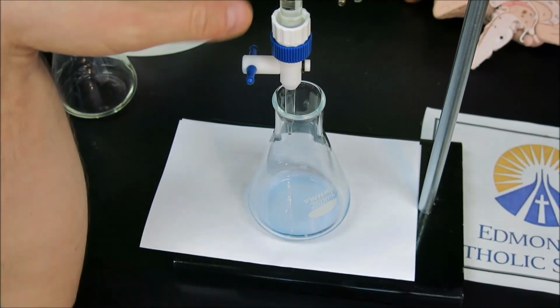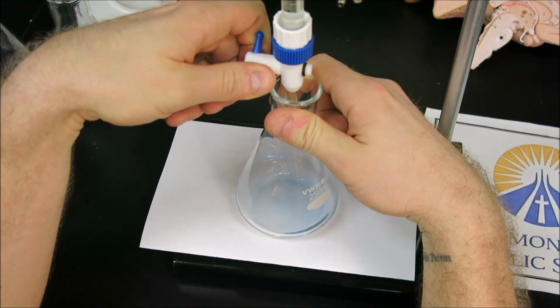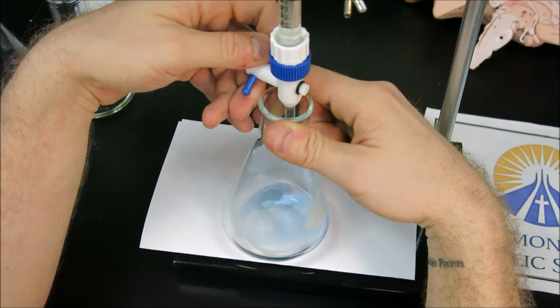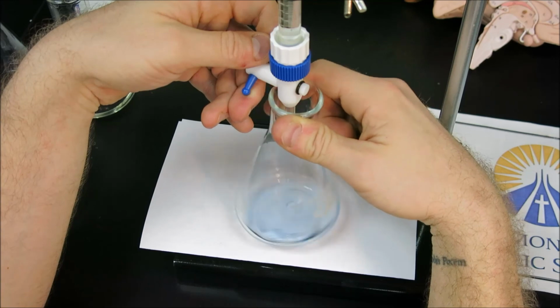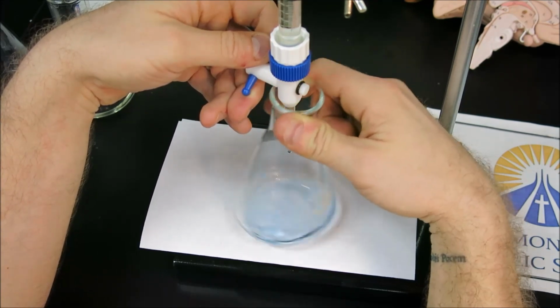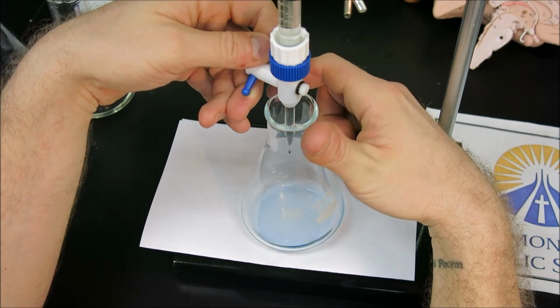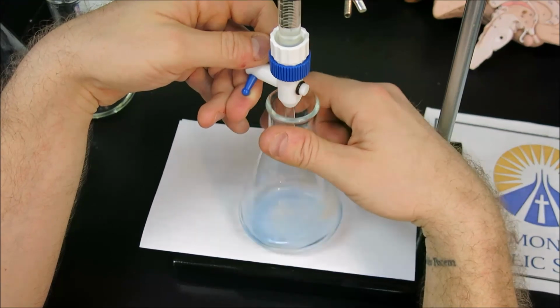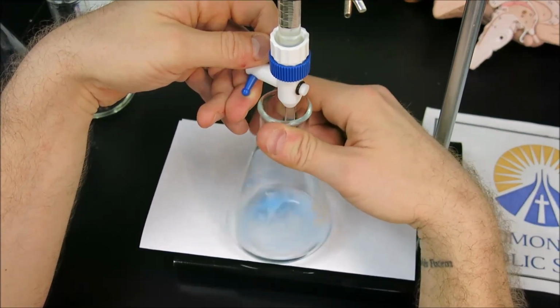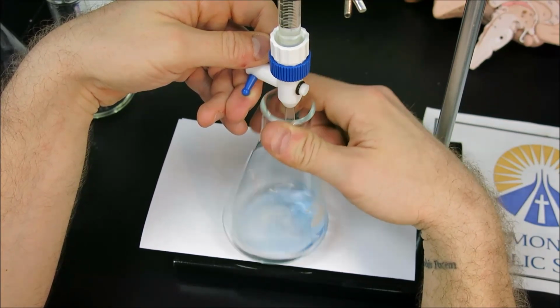Now to finish the titration, we will slow down, titrating a drop at a time. And I can see the color is starting to change here. I'm getting very, very close to the end point. If I leave it just sit, you can see the yellow stays in the center until I swirl. Perhaps only a few drops more.